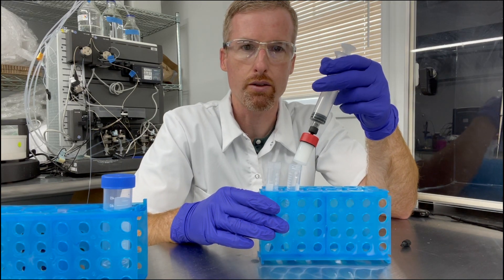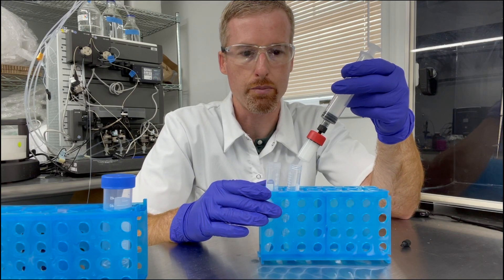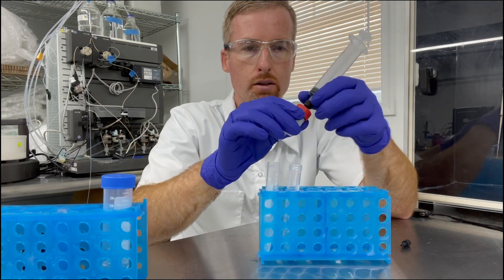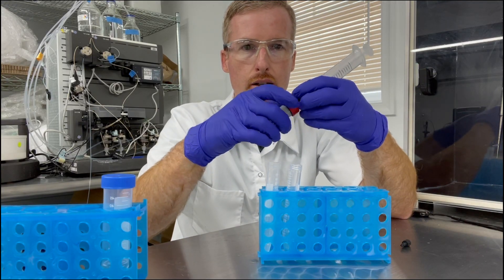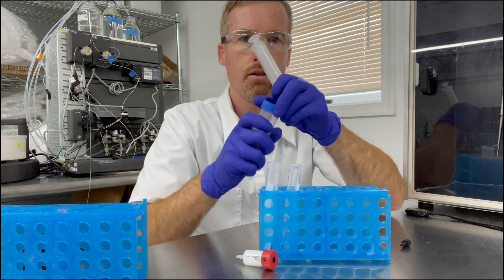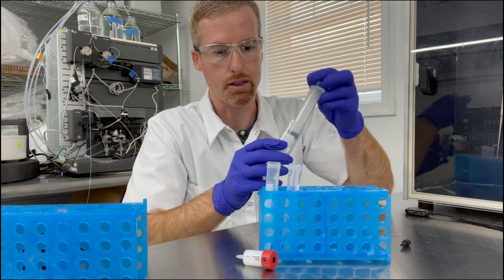Okay, so I've flowed the protein into the column. About half of it has come through and half of it is still in the column. So I'm going to get my five mils of buffer A and pull that into my syringe now.